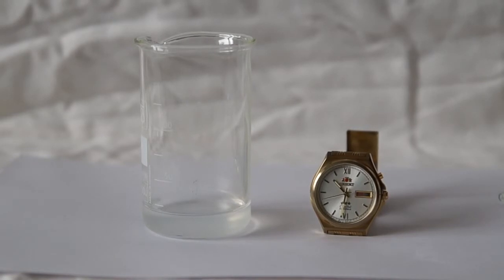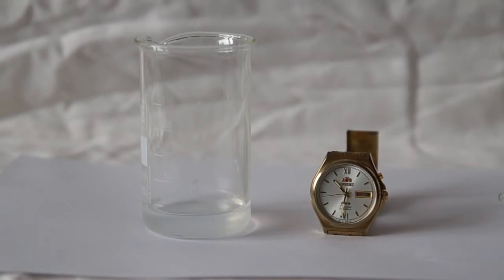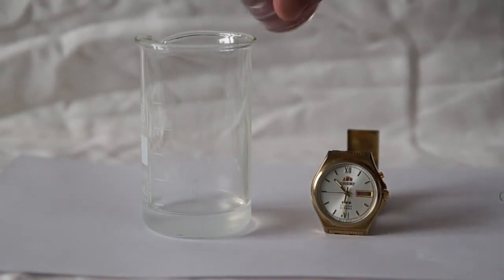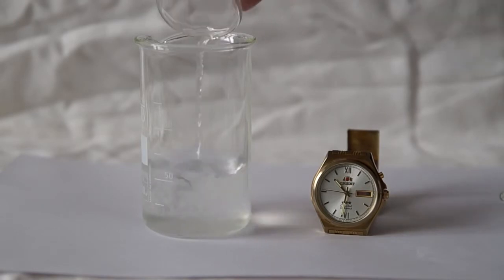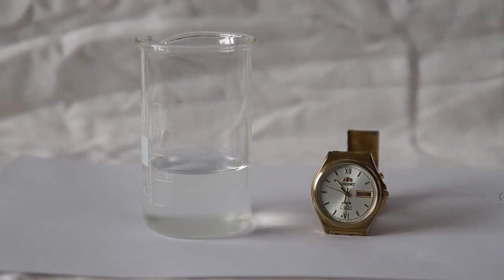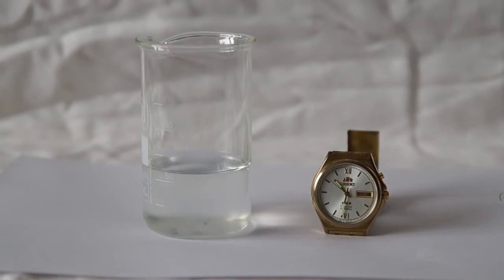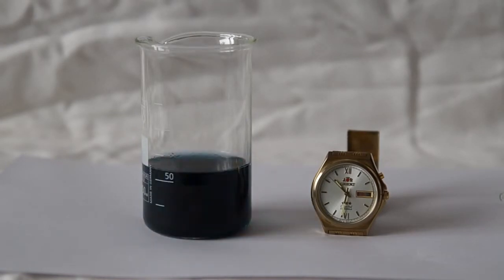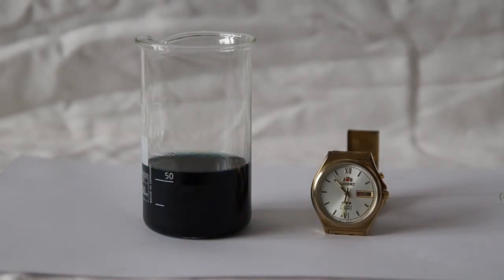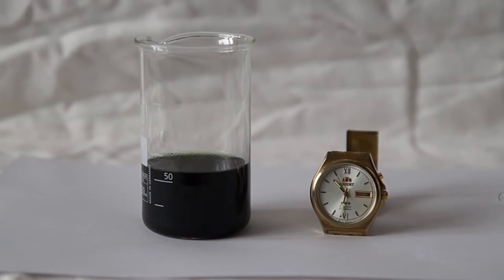In the main beaker I poured 20 milliliters of the first working solution, and now I am pouring the second working solution into the beaker. Time passes and the solution rapidly becomes black. The color change is the reaction between iodine and starch.